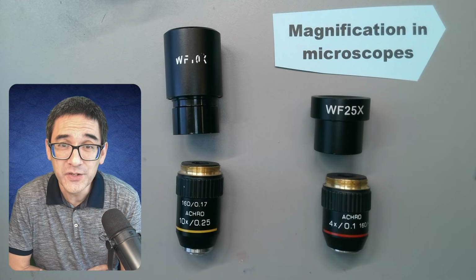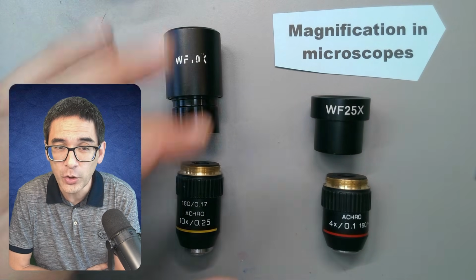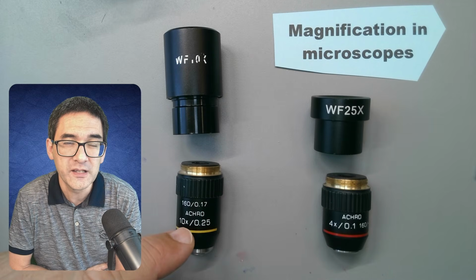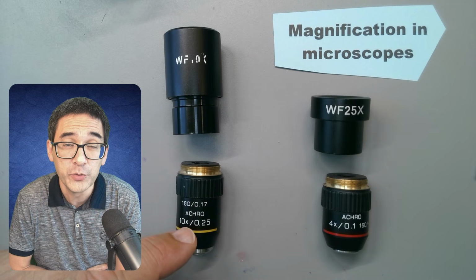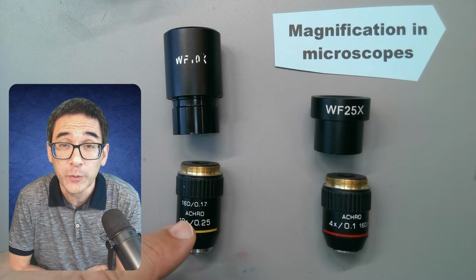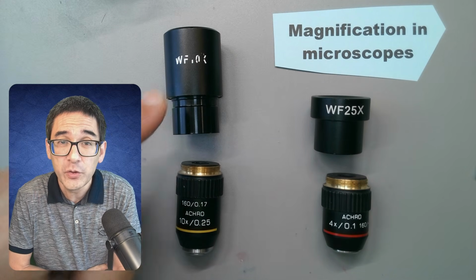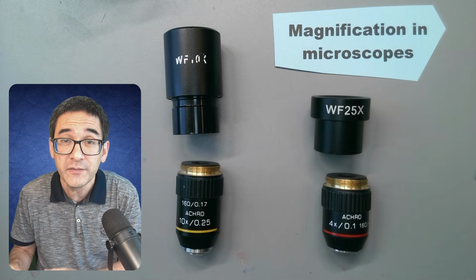Does it really make a difference which combination you use? Actually, it does make a difference. You should always use the combination with as large of an objective magnification as possible, because it's the objective that determines the clarity or the resolution of the image. So this combination over here will give you a better image quality than this one over here, even if the magnification is the same.